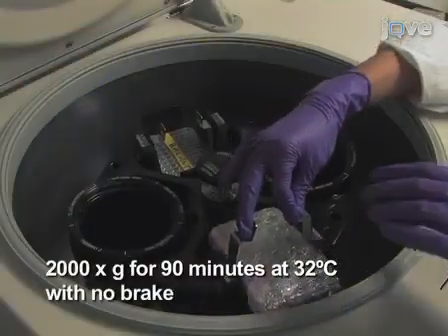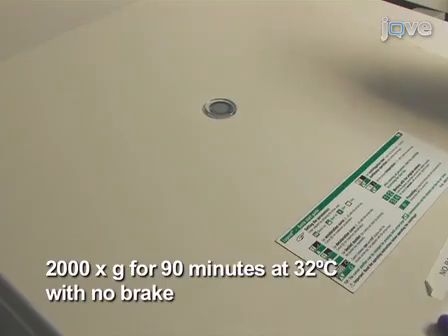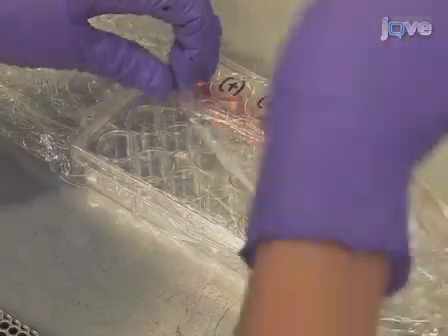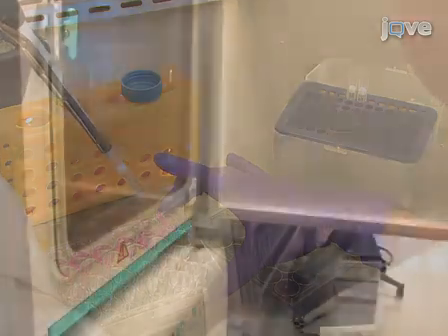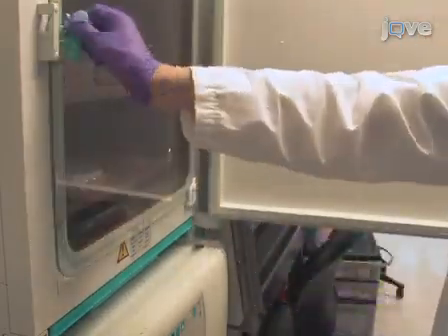Centrifuge for 90 minutes at 2000 times G at 32 degrees Celsius with no brake. After the centrifugation, remove the plastic film. Add 1 milliliter of fresh rPMI medium with 20 nanograms per milliliter of recombinant human interleukin-2 to each well. Put the plate back into the incubator.